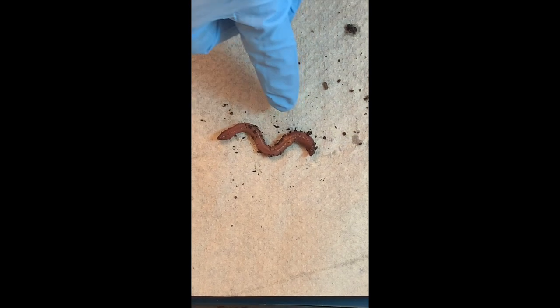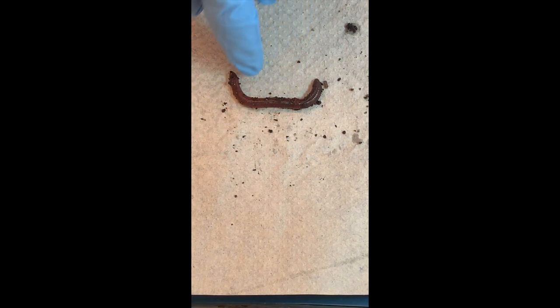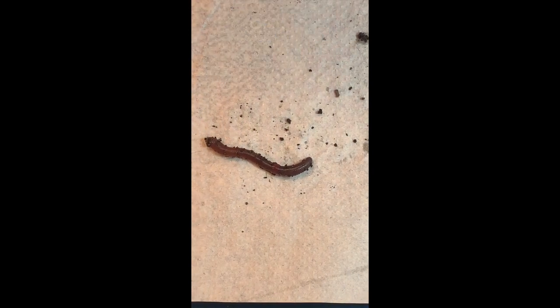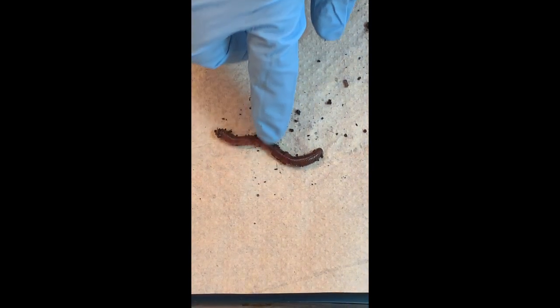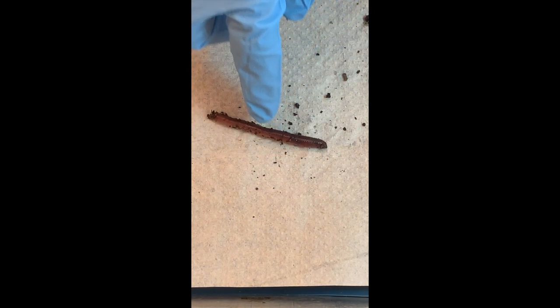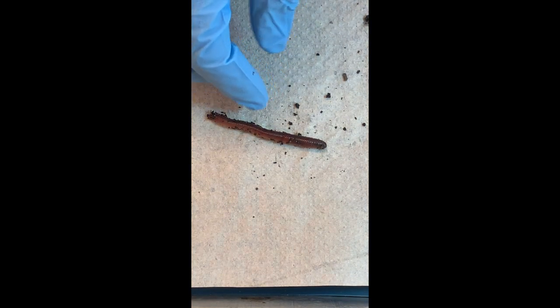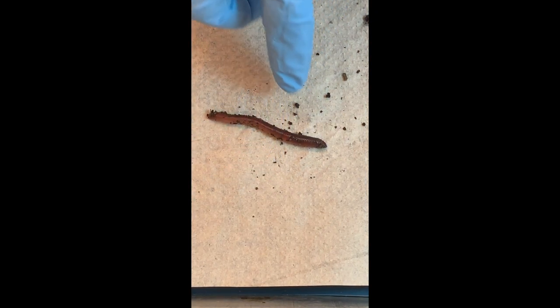This one flipped onto its ventral side, so we can see it has a lighter color. It's very difficult to determine where's the head and where's the tail when they start moving. So you're saying an earthworm has a head? Yes. Where are the eyeballs if it has a head? Do you need eyes underground? I guess not — it would really be bothersome, so they gave up on that.